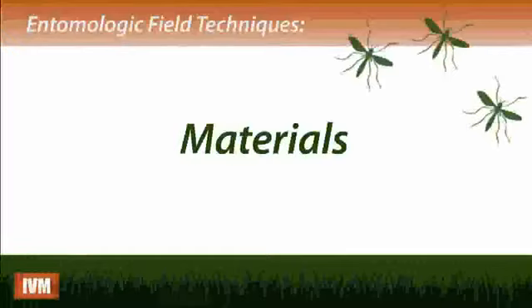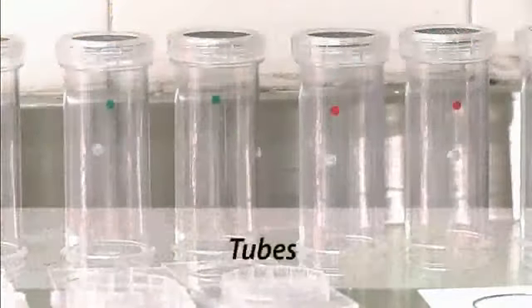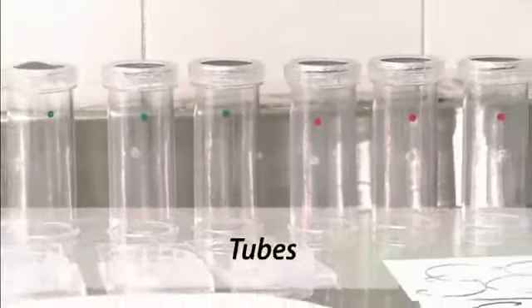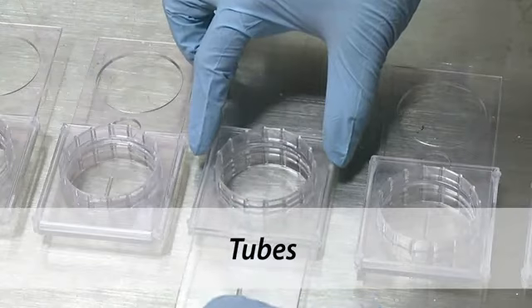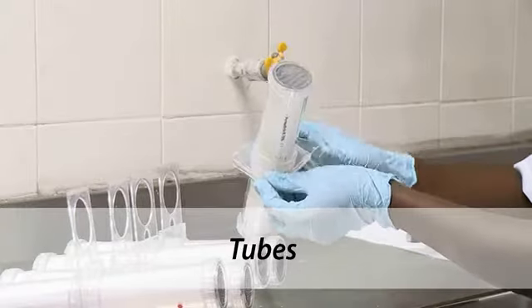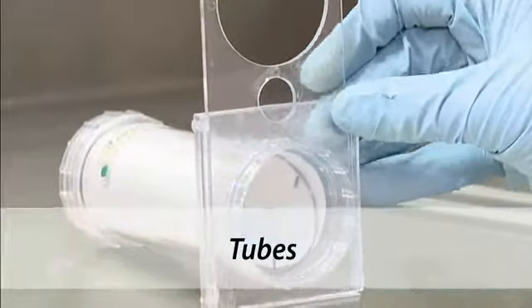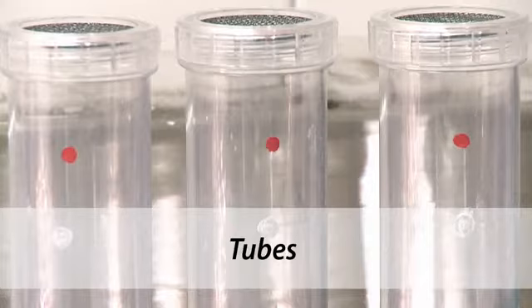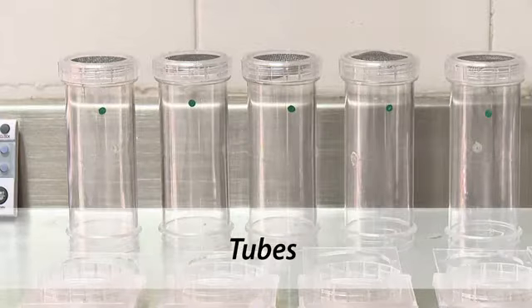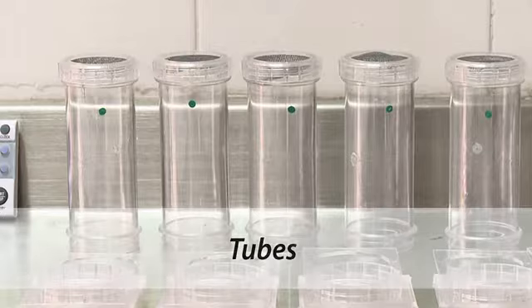Materials necessary for the WHO bioassay include the following: 4 exposure tubes and 1 control tube. Plastic tubes have screw caps on each side, along with a mesh covering on one end and a sliding plastic plate on the other, with a 20mm hole through which mosquitoes are introduced. The tubes with red dots are used to hold the insecticide-impregnated papers. The green tubes are for the papers without insecticide: control papers and resting period papers.